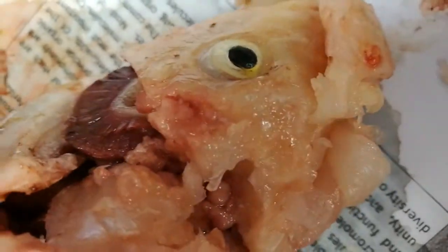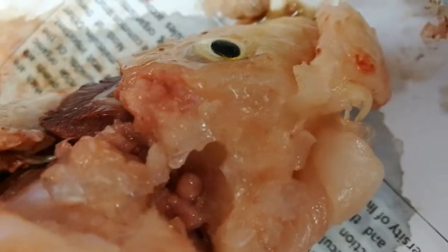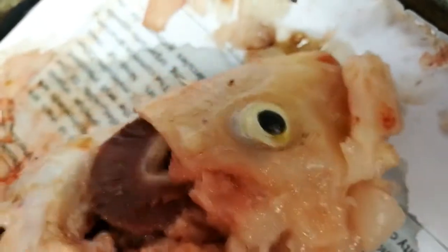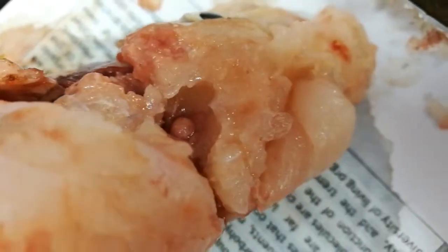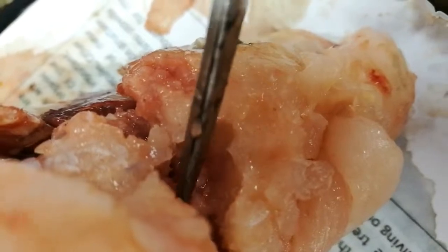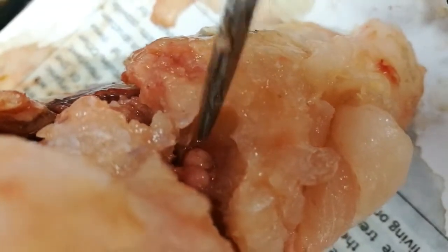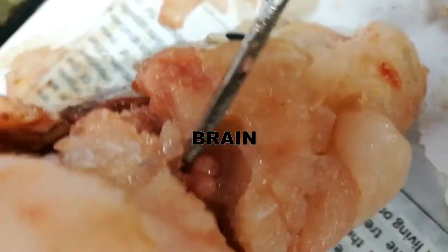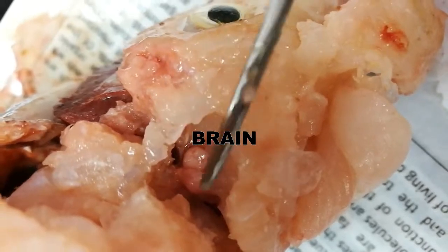The last organ we are going to identify is the nervous system. We cut open the head, and you can see this tiny round shape — it is actually its brain. It is located inside a round cavity inside the head.